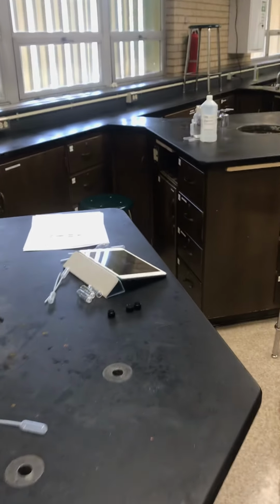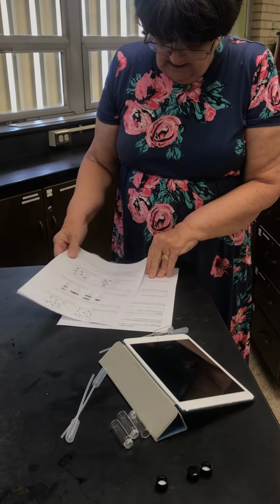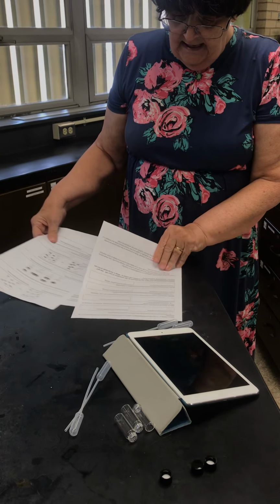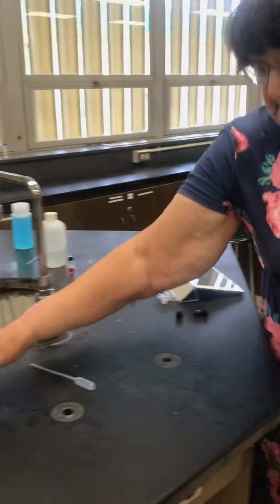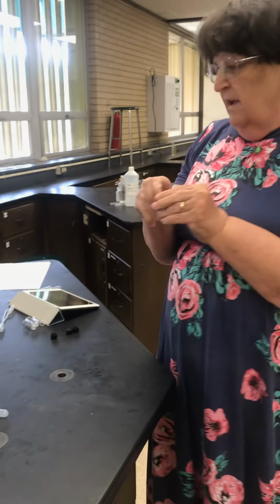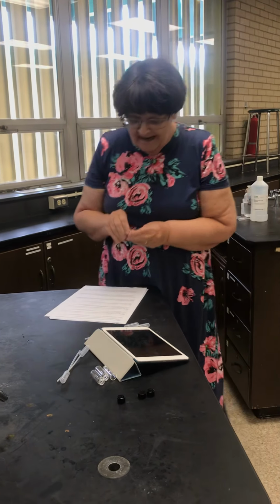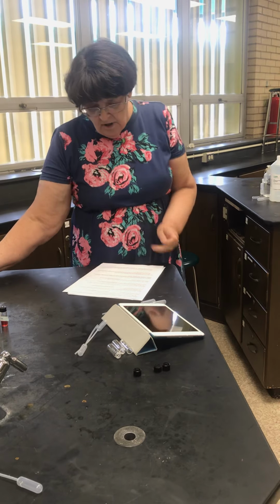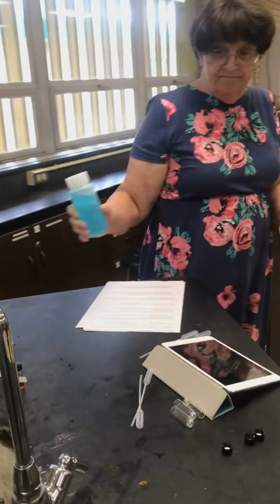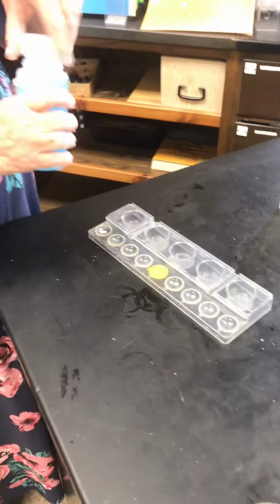Next one on my list says, did that one. Next one on my list has to do with magnesium ribbon. Magnesium ribbon is some of my funnest things to play with. If you were here, you'd like to play with it too. One of these days we'll catch it on fire just for the heck of it. And we're going to add copper chloride to it. So here goes. There's my magnesium. And here's my copper chloride.